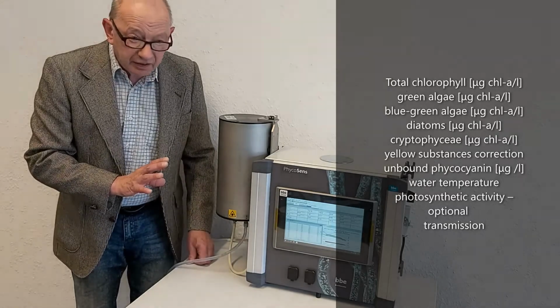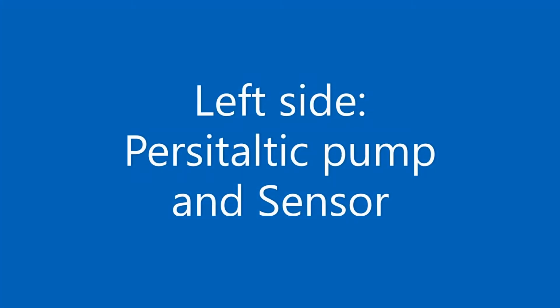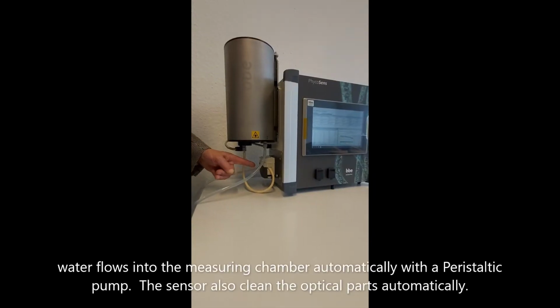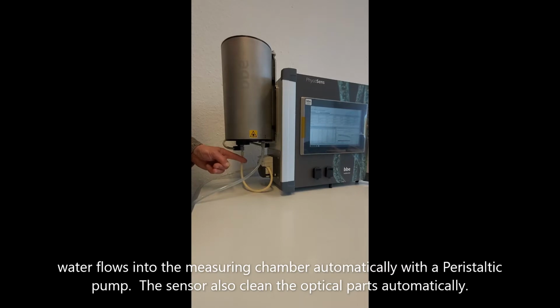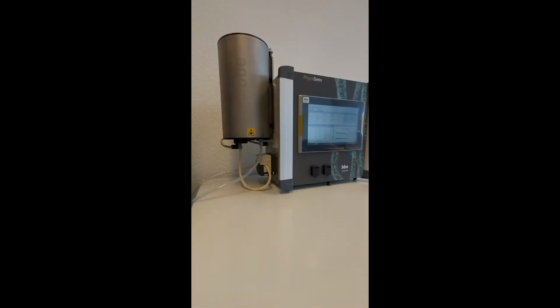I will direct you now to the pump. Here you can see a peristaltic pump which transports the water from the river or from the sampling place into the sensor where the algae are measured. And this pump is of course controlled by the PC.